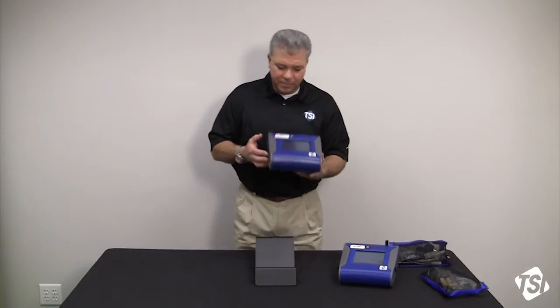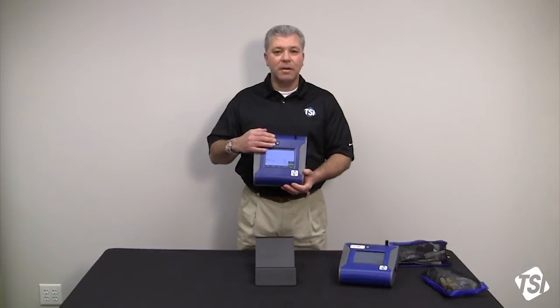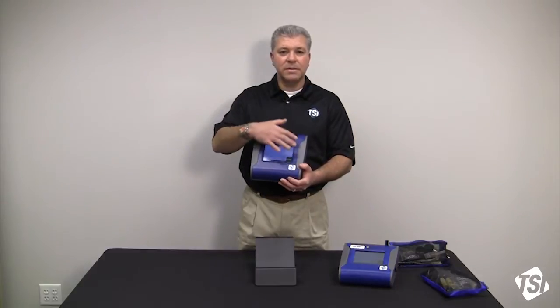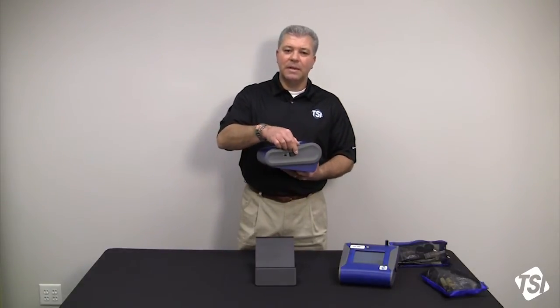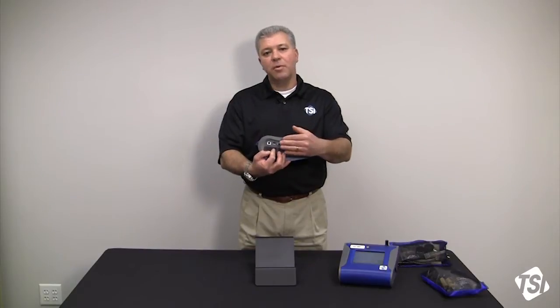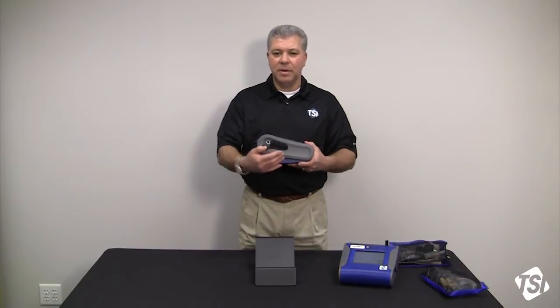Quick rundown — we're going to identify the components first. You've got the on-off button here on the front of the instrument. You have the aerosol inlet right over here. The color touch screen is down here in the front, and the power port is off to the left side, covered up. We have some other covers for the communications ports: you've got an analog output, a USB device host, and Ethernet communications.